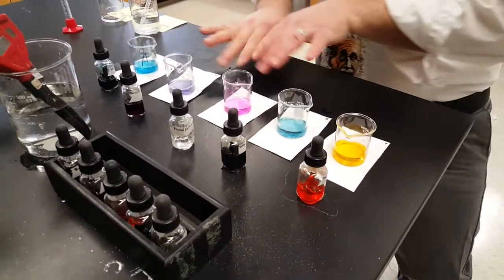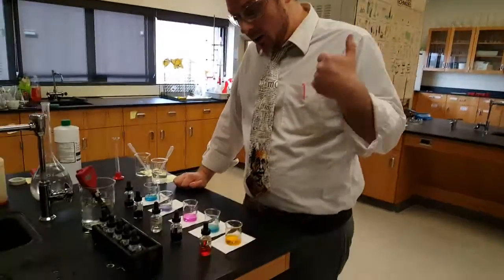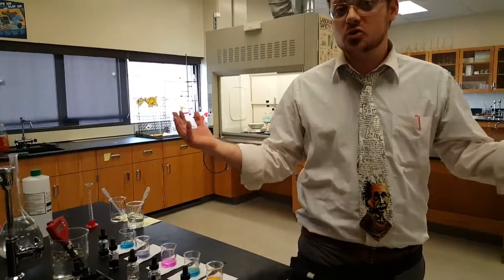Look at the pretty rainbow. If you're good and you really understand this and you work through this unit quick, I would love to see somebody step up to the plate and make a red, orange, yellow, green, blue, indigo, and violet. I want a chemistry rainbow if you can hack it, but you've got to do the basics. You've just been challenged. Challenge accepted. See ya.